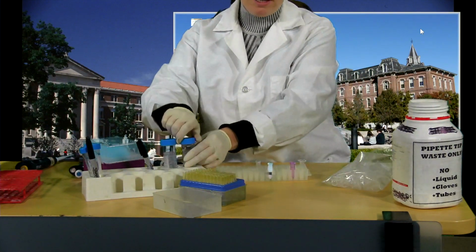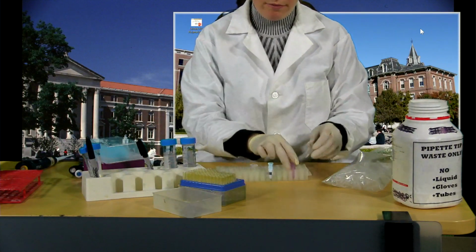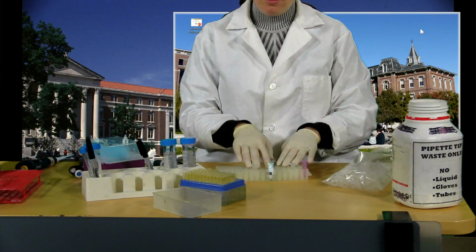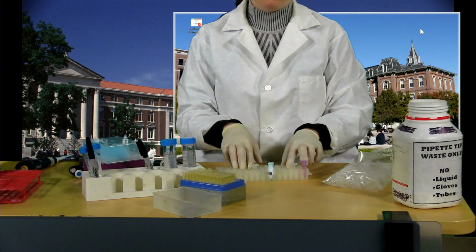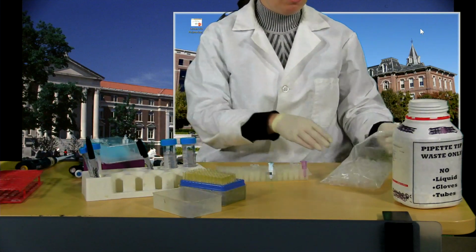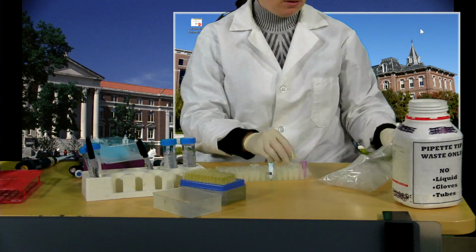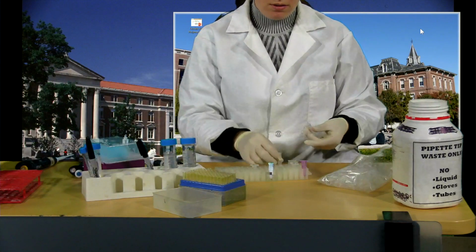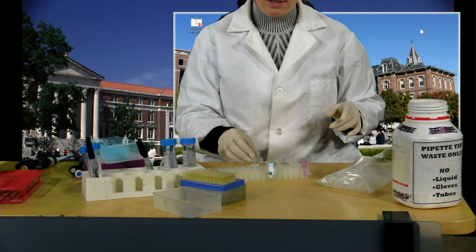Okay, so I have both of my dilutions made up. Now I need to set up my enzyme assays. So I essentially have four samples that I'm going to be assaying. I have my crude here, the original, the undiluted, and a 1 in 10 dilution, and then my purified and a 1 in 10 dilution of that. So I'm going to need 4 assay tubes. So 1, 2, 3, 4 for each of these.